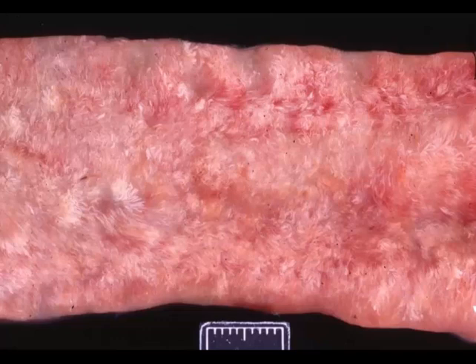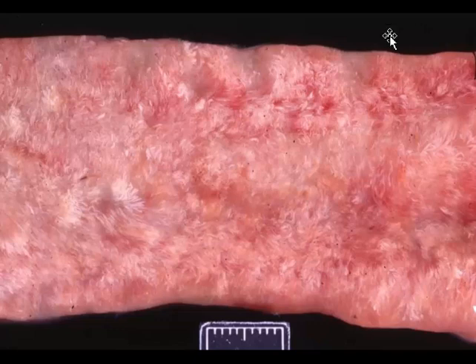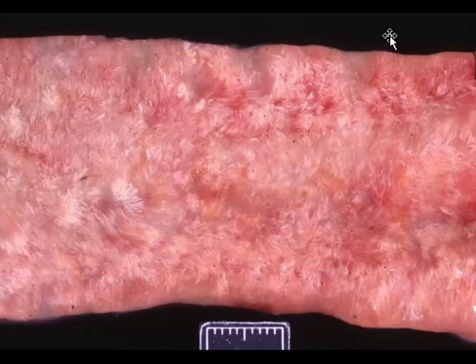I did work a lot with dogs and cats and some exotics in various urban practices in Atlanta, Georgia. So we're back to dogs. I would like a morphologic diagnosis, and I want you to give me a likely breed. Okay, time's up. This is a great picture.